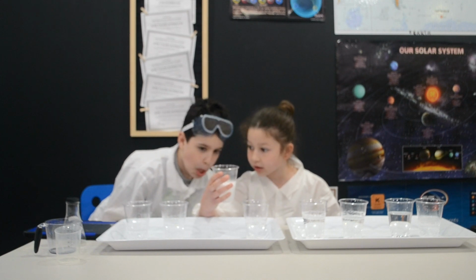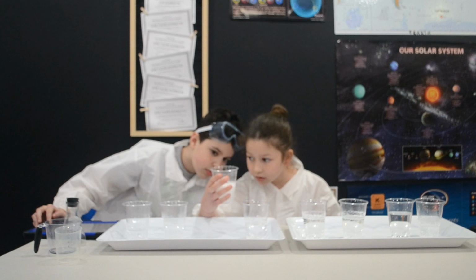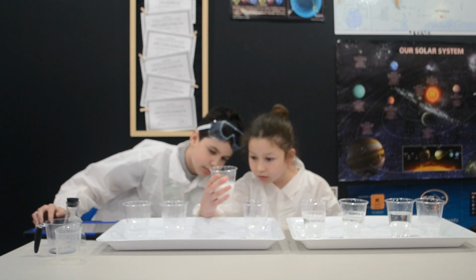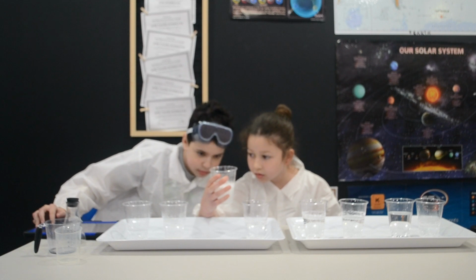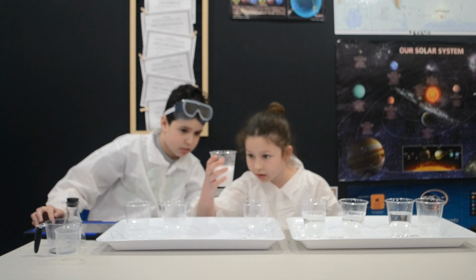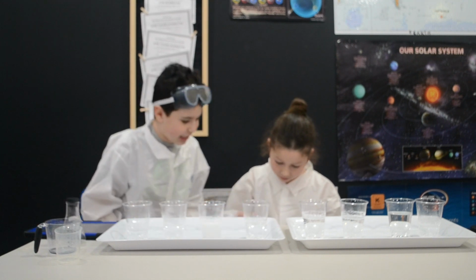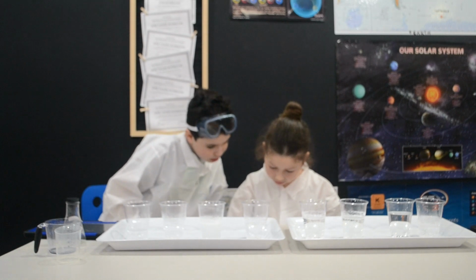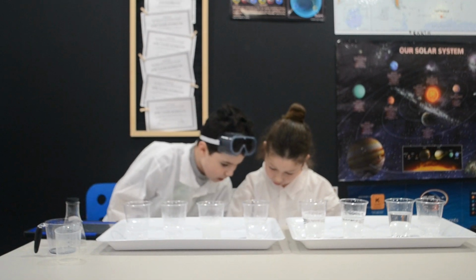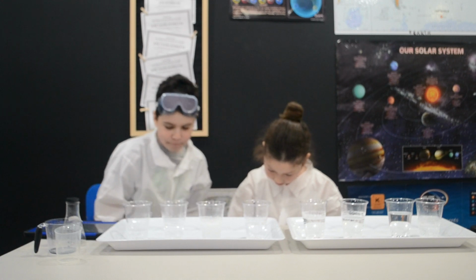You have to get your hand ready. I'll tell you when it's over. And done. 54.48 seconds. 54.48 seconds.